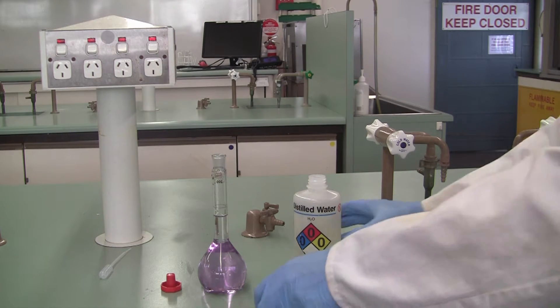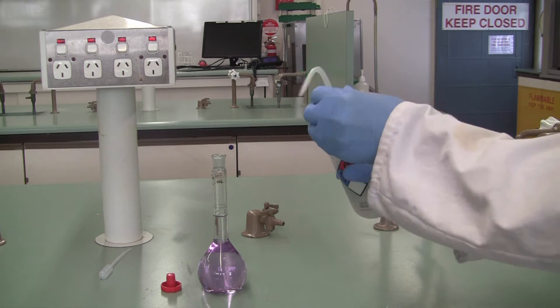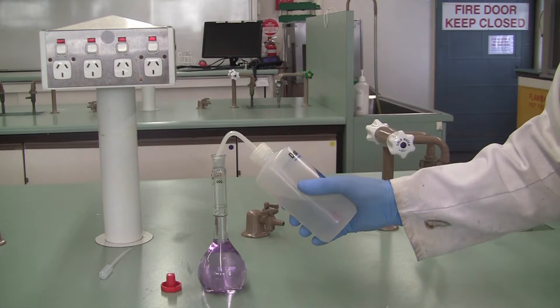So once you get close, pop the lid back on your wash bottle and then make your way slowly closer and closer towards that mark.